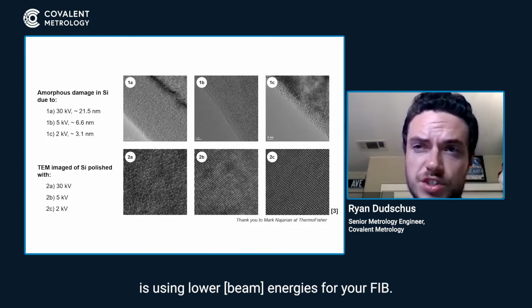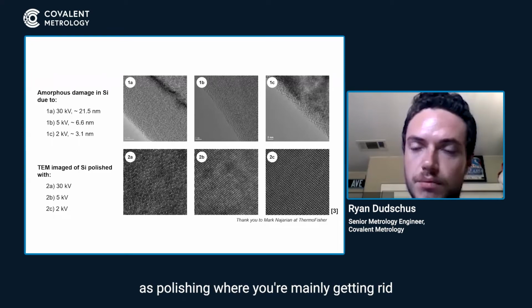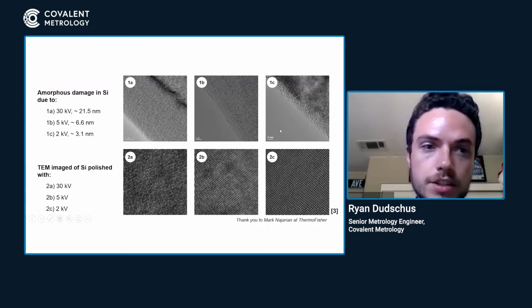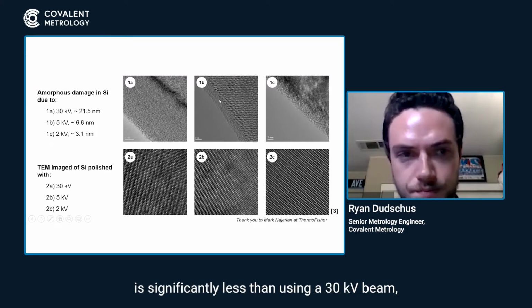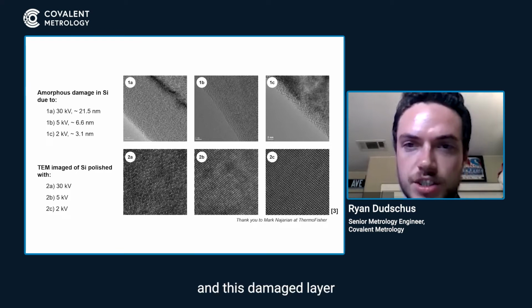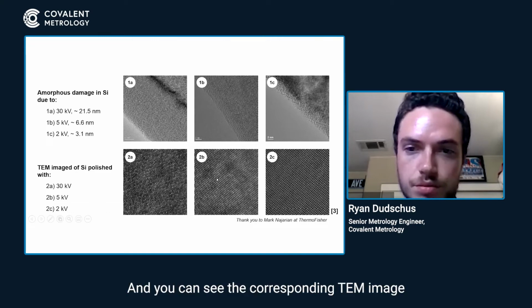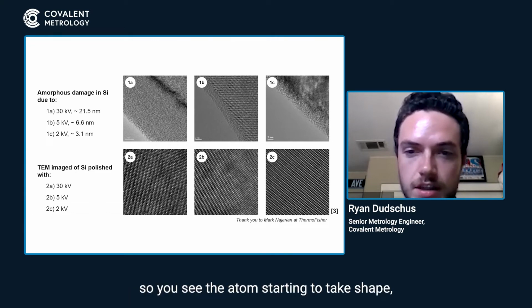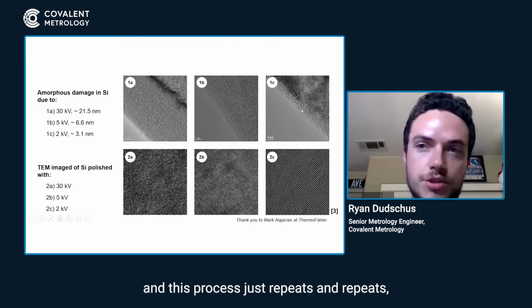The way you go about this is using lower landing energies for your FIB. So you drop it down to 5 kV, and this is what's referred to as polishing, where you're mainly getting rid of this damaged layer. So in 1B, you see that this damaged layer is significantly less than using a 30 kV beam. And this damaged layer is about 6 or so nanometers thick. You can see the corresponding TEM image when it's polished with this lower energy. So you see the atoms starting to take shape, not as much damaged layer going on, just a better resolution. And this process just repeats and repeats.